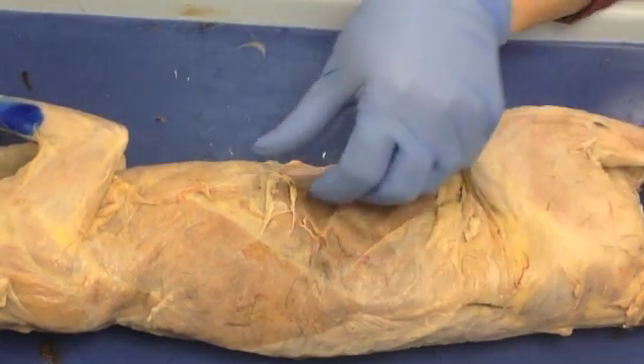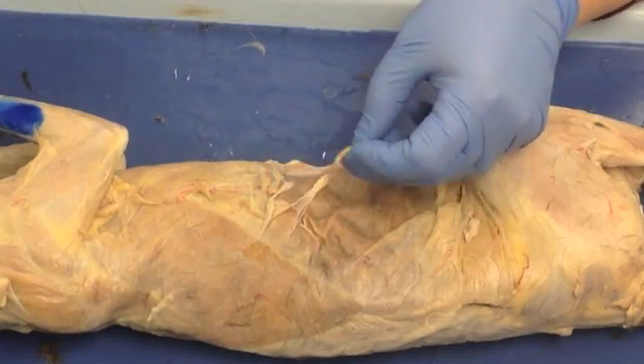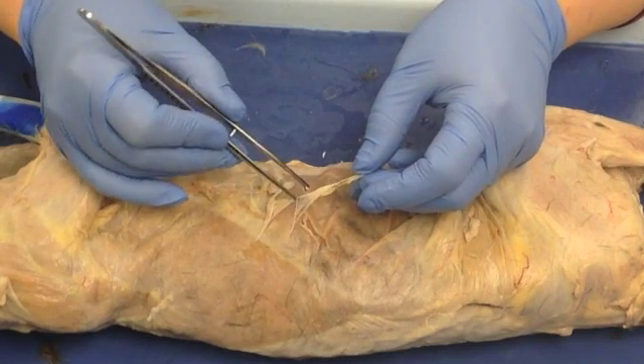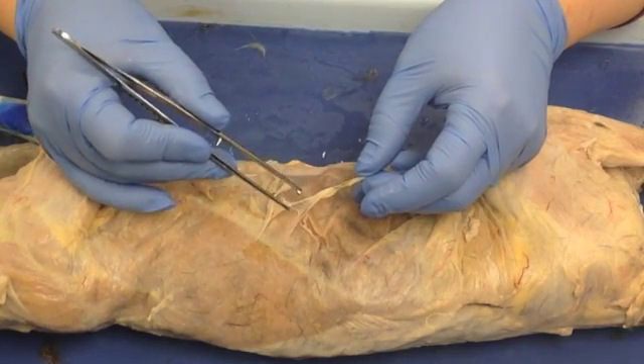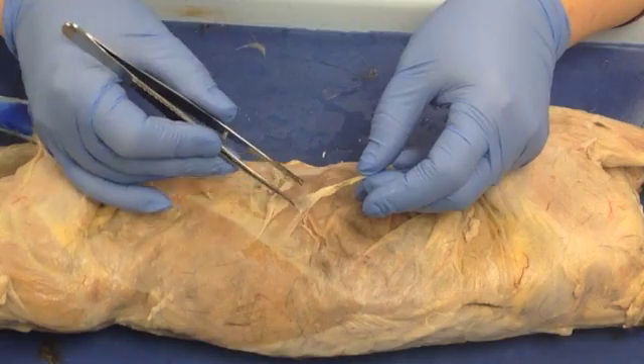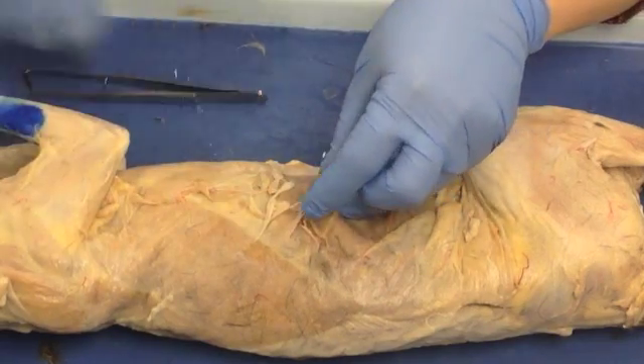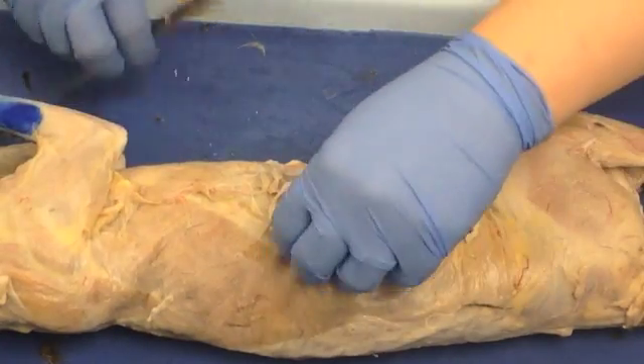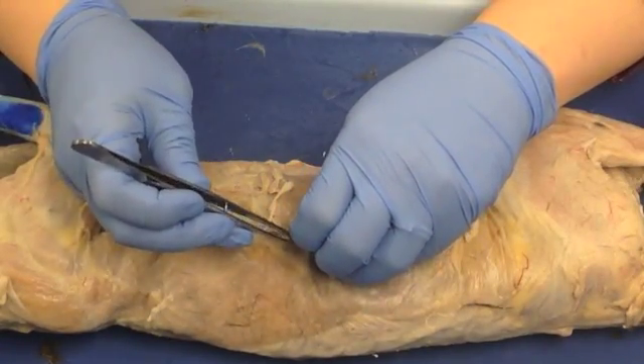Some things are fairly obvious. For example, here we've got some adipose with some loose connective tissue. You can see that it's attached to a tiny little artery, something you will never have to identify on an exam. And that just pulls off very nicely — in some cases, that's really all you have to do.